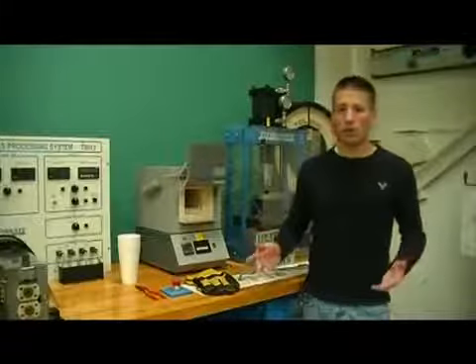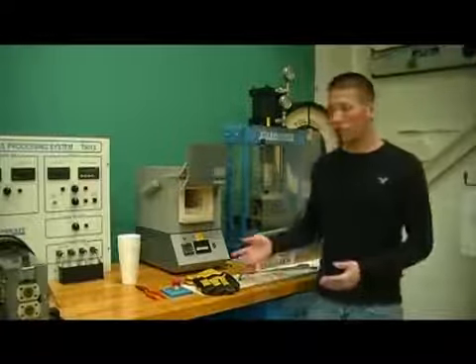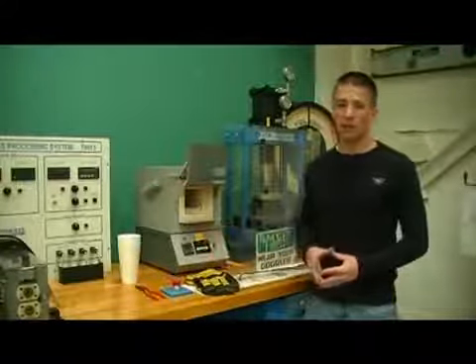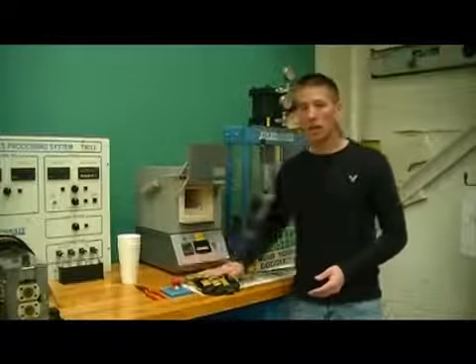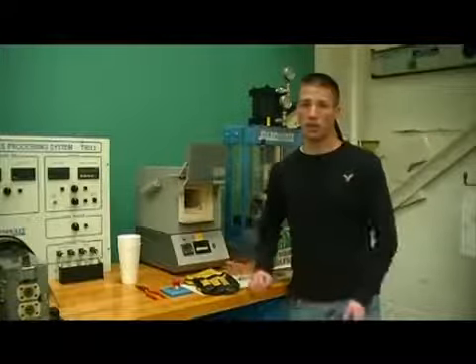As always, one important aspect of every lab is lab safety. In this lab, we're going to be dealing with temperature extremes, both on the cold and hot side of things. Our cold samples will be in dry ice. Therefore, make sure you use the supplied pliers and gloves when handling those samples. They will be found in the white styrofoam cup.